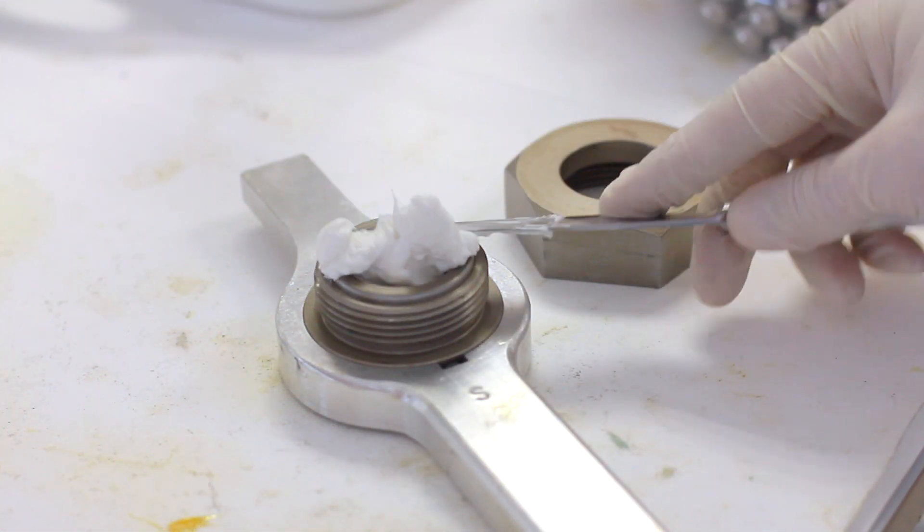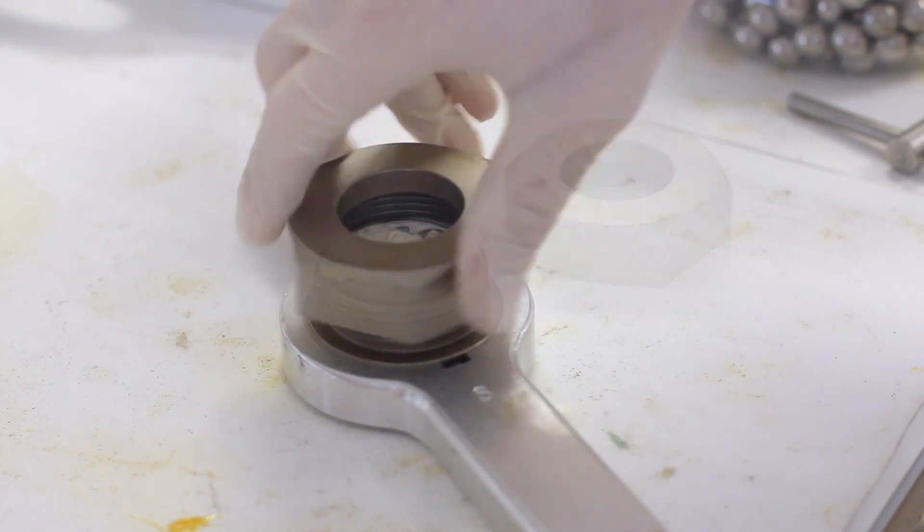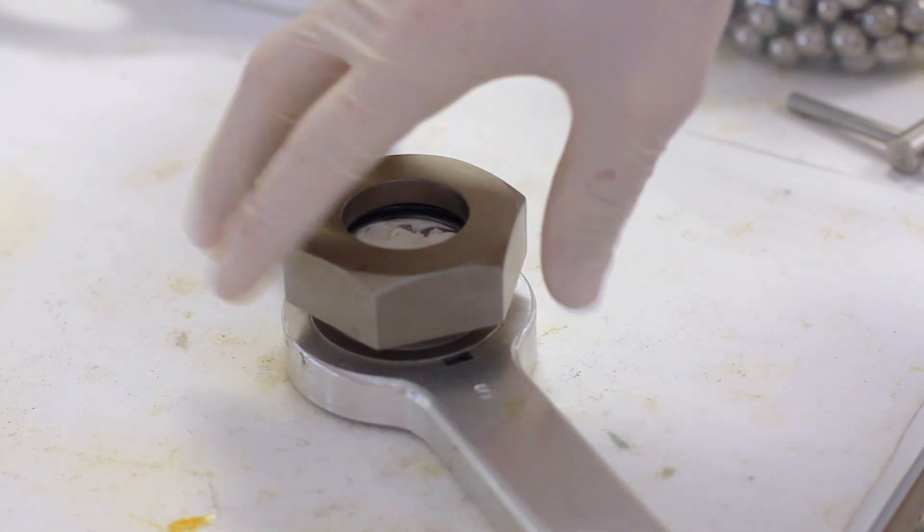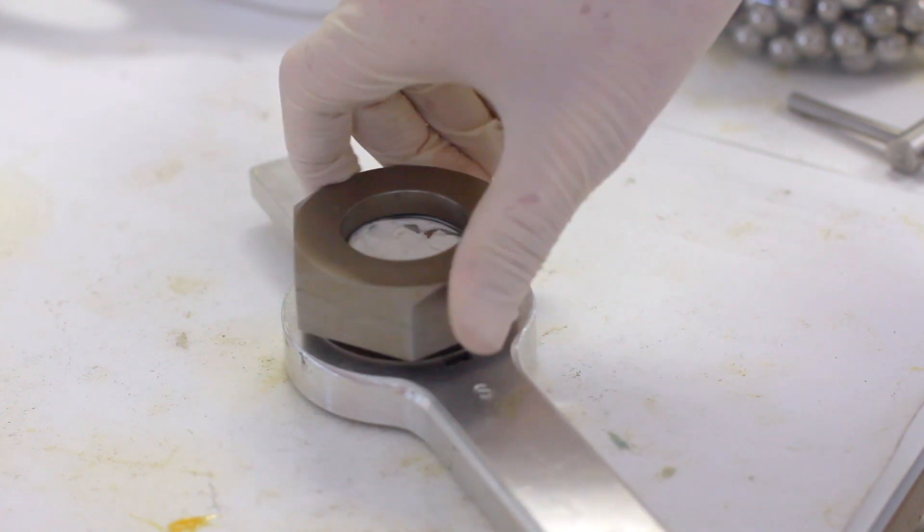The formulation of this grease enables a metal to metal contact to be controlled, reducing the friction and wear and preventing the catastrophic build-up of heat.